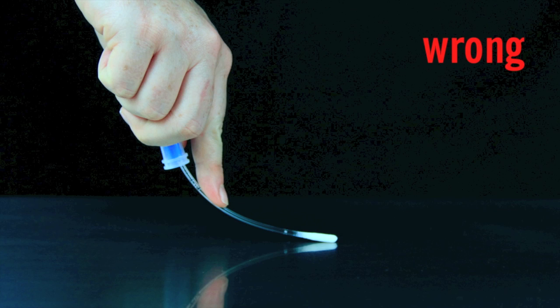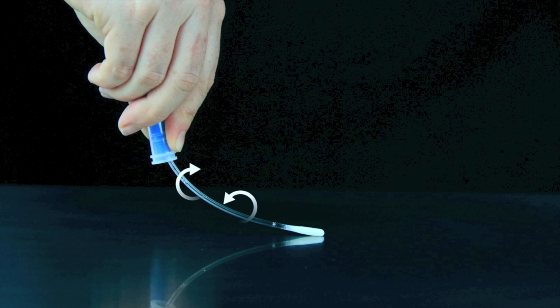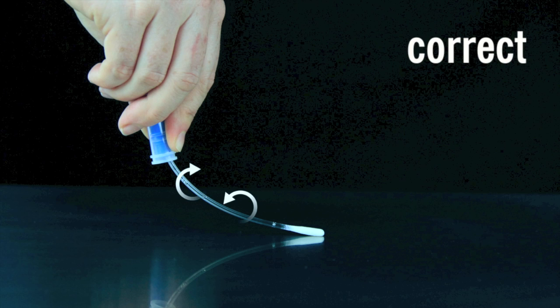Be sure not to touch the swab shaft while collecting sample. Touching the swab shaft contaminates the test and will produce inaccurate results. Rotate the swab tip while collecting sample to ensure maximum sample collection.